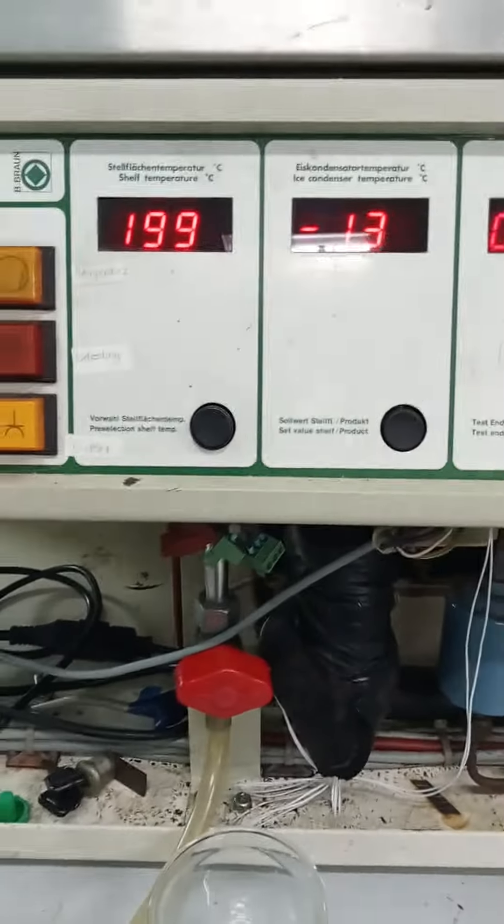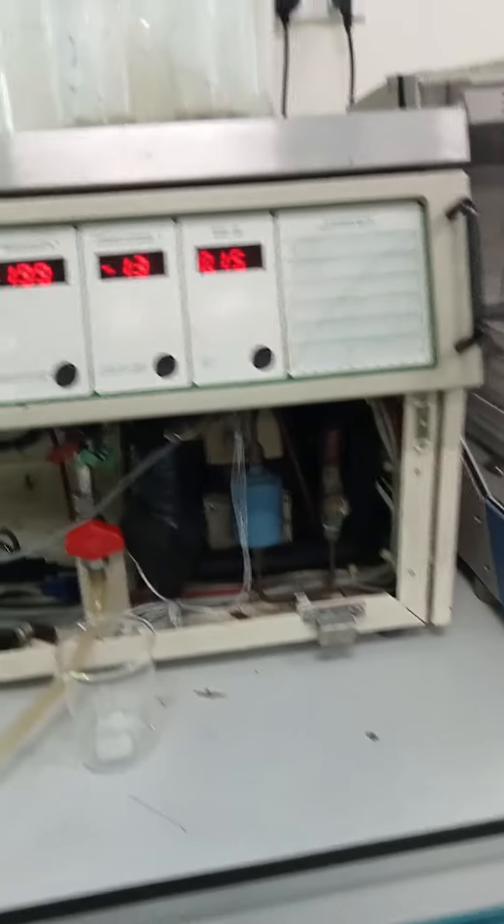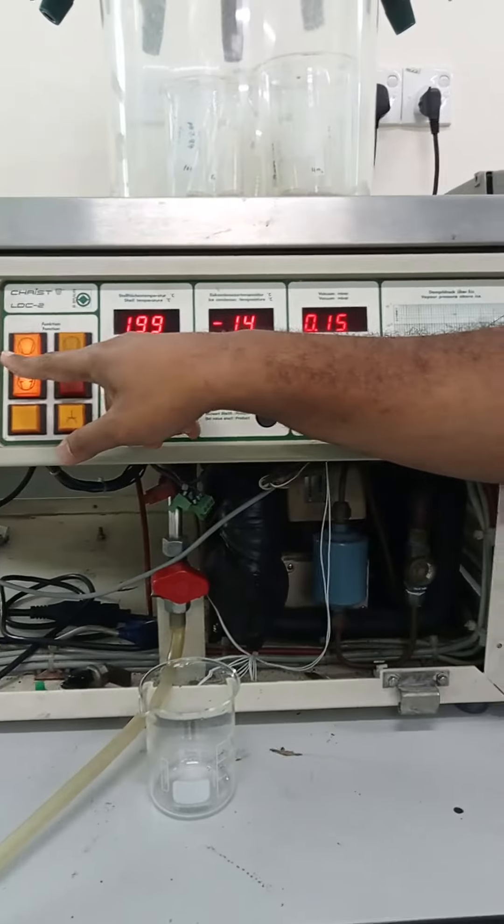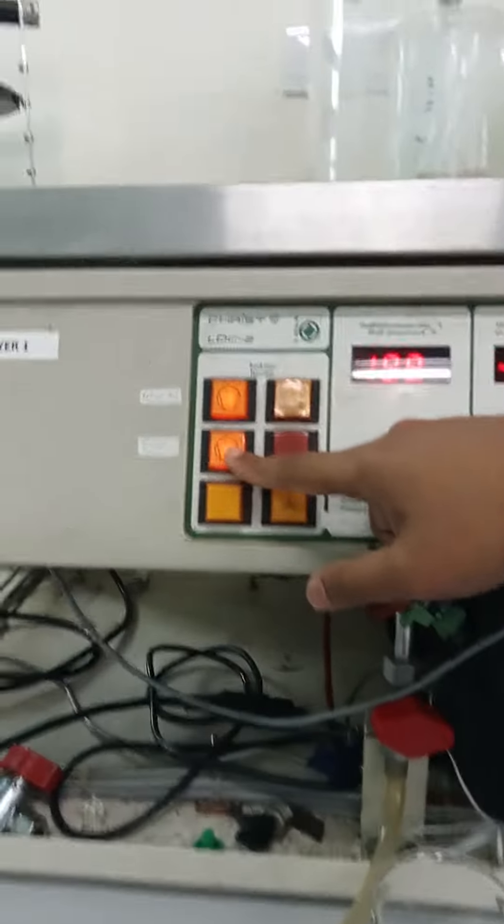Back off, that's all. So, later, if you want to switch off, switch off this first — vacuum force.